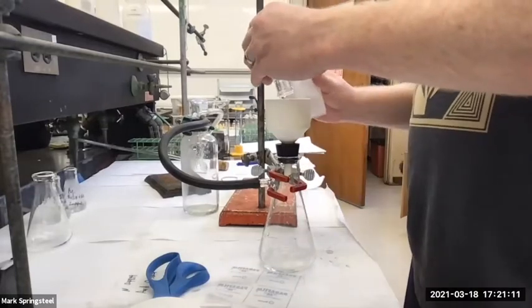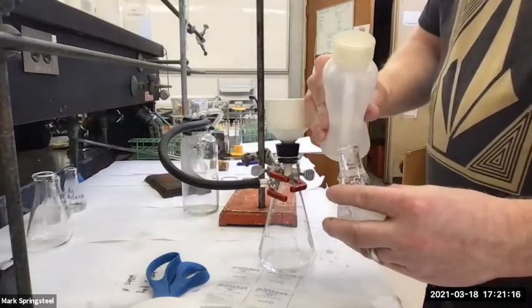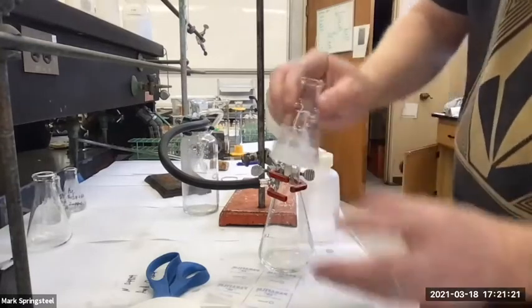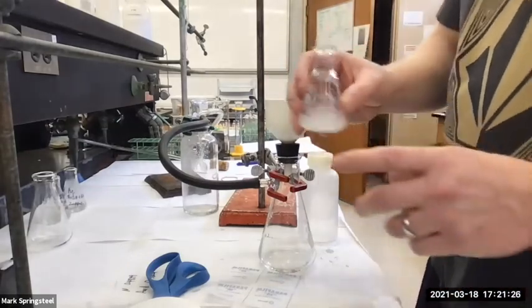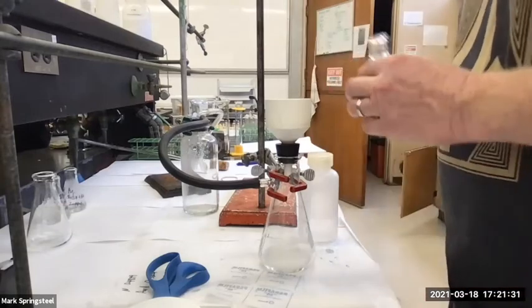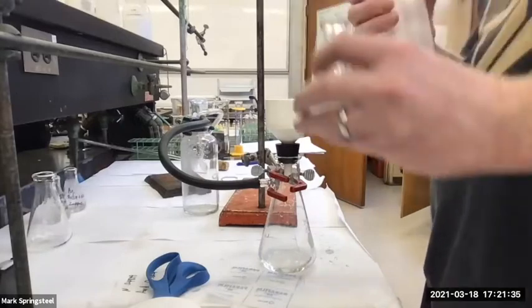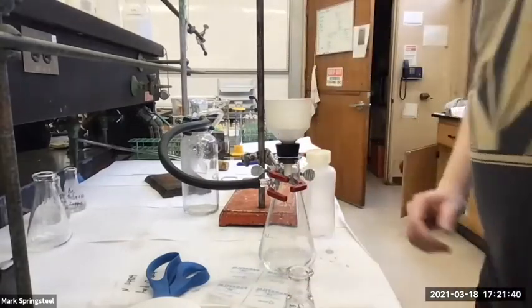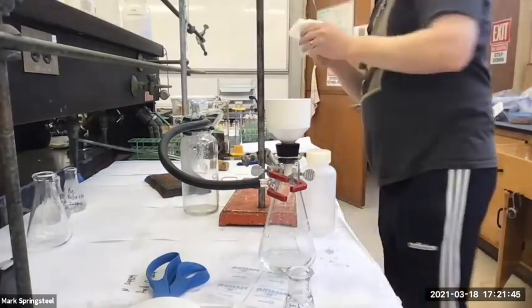And then I can start rinsing it. I'll put some water in here, and I'm going to be watching to see, is this solid dissolving really well in the water, or is it okay? Nah, it looks fine, huh? So I'm not too worried about adding too much wash water right now. Let's get some more. Something's really stuck, huh? I think I'll use a spatula to scratch it up.